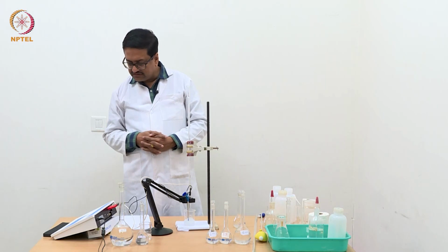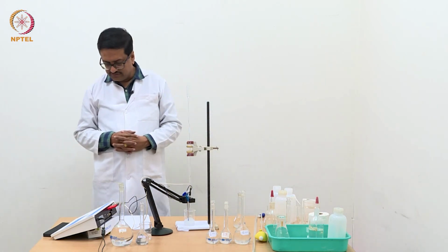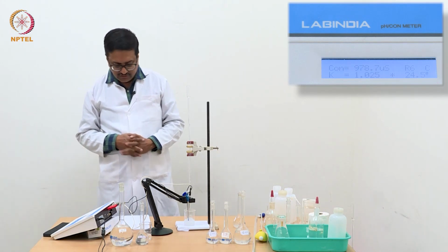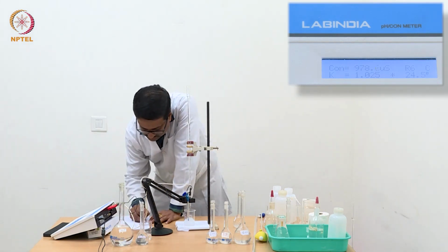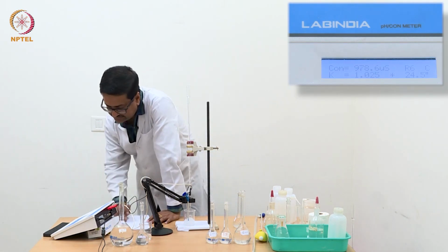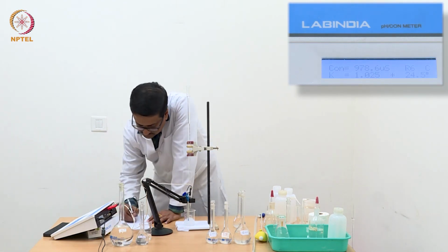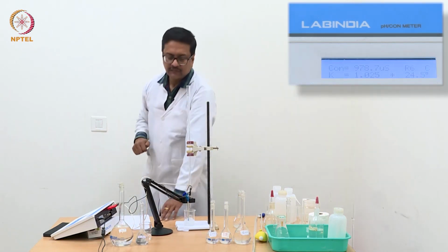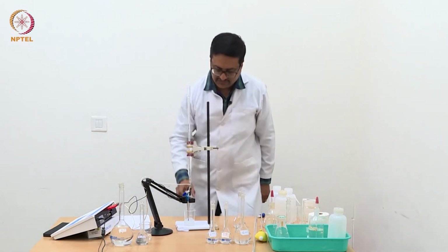So you see that it has increased to 978, maybe 979, so at 1.5 ml, it is 978.6. So it is in the increasing trend.